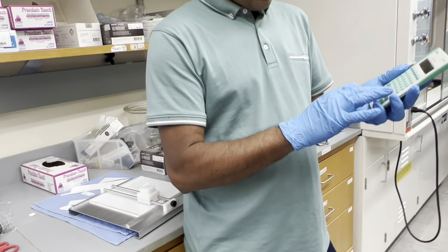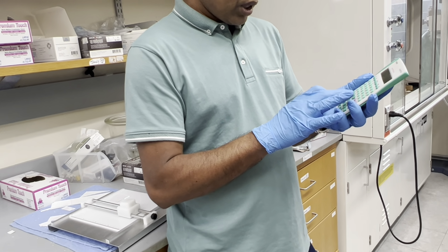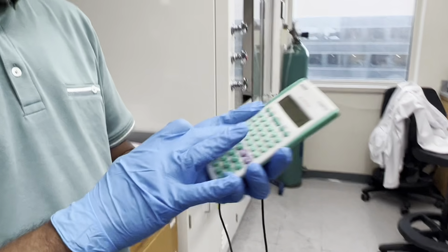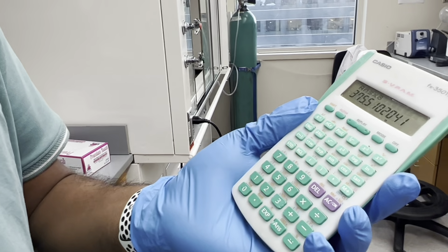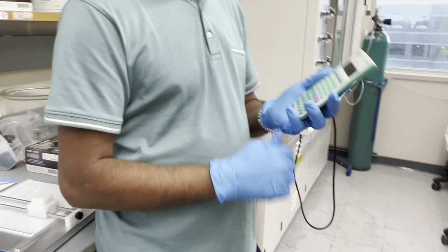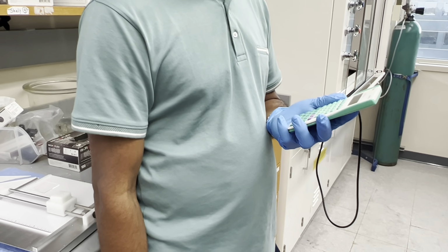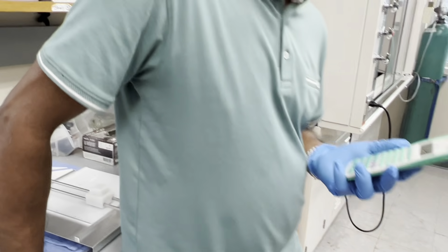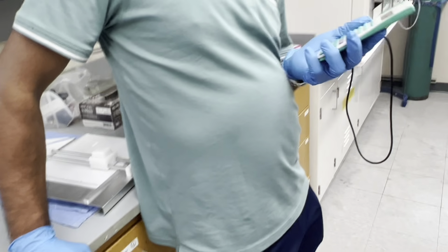So 9.8 contains 460, 1 contains how much? So 460 divided by 9.8, 46 times 8, 375.5. Okay. But isn't the acid solution already in there too? So why are you calculating with 46 and not the 49? The HCl is already in there too. So why are we even using the 460 microliters at all? Shouldn't we just be using the total 490 because they're all together now? Yeah, that's what I'm saying.